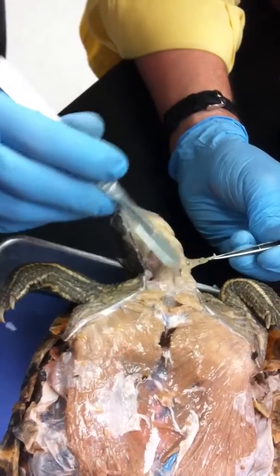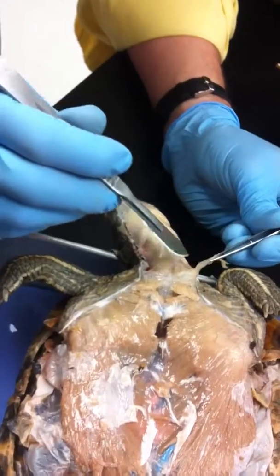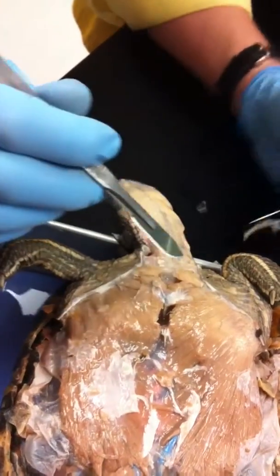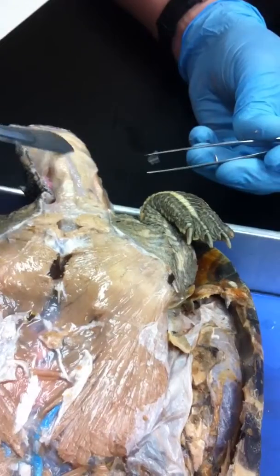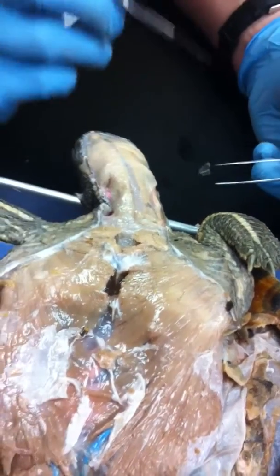It's real easy to mistakenly cut away the layers underneath — like I just severed that right there. Do you see this muscle here that goes like a rubber band? There's your omohyoid.